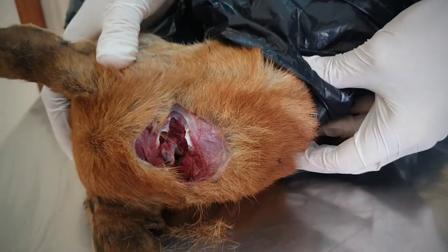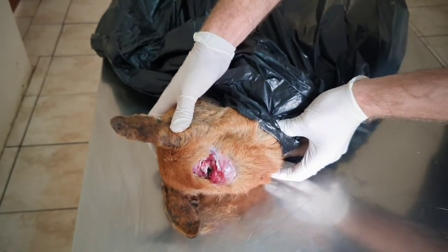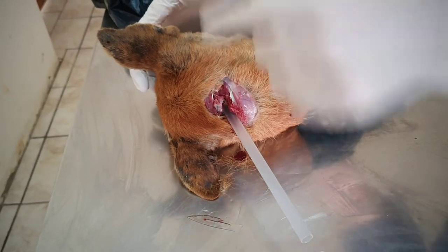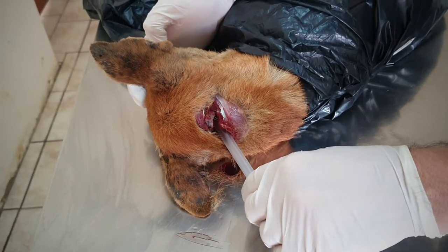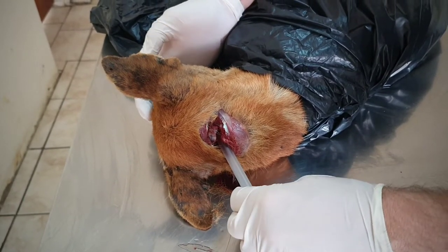From there what we do is we push the dog's chin against its chest — that just opens up that gap a bit better for us. To get in through the foramen magnum, as I say with them lying like this, I prefer to go for the top eye because then you're running on a straight plane, but you can go for the other as well. Just aim at one of the eyes so that you get a representative sample of the brain and that you're not running between the two hemispheres.